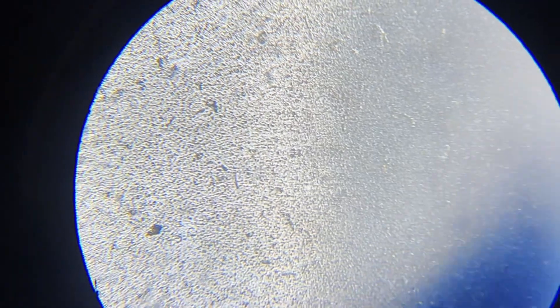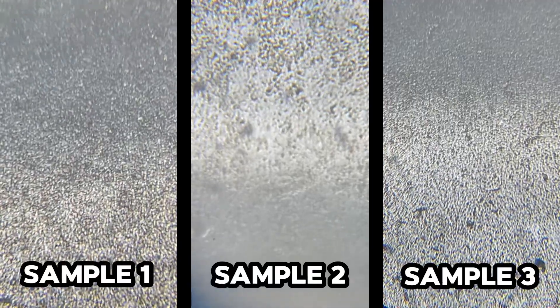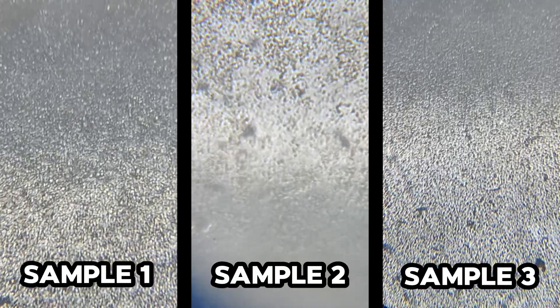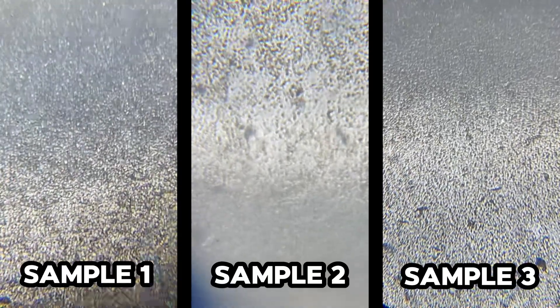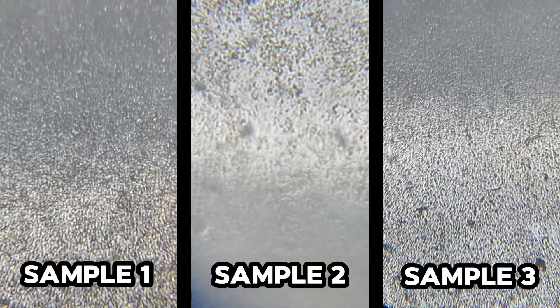In this sample we are seeing less than 5 percent motility in the semen. Sample one and two are having good semen quality — we can use only this type of animals for artificial insemination in rabbits. This third type of animal we don't use for mating or artificial insemination because there are no results from these animals.